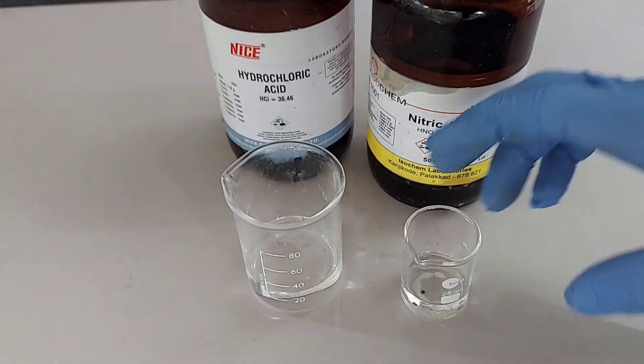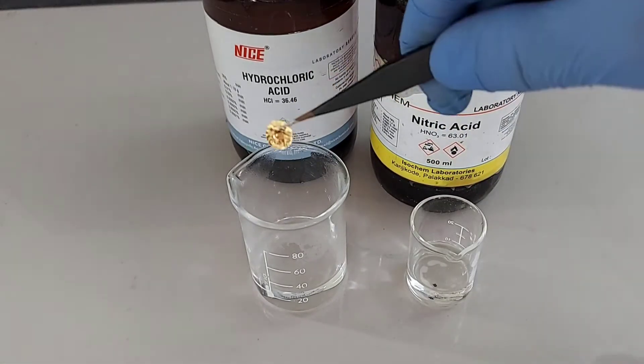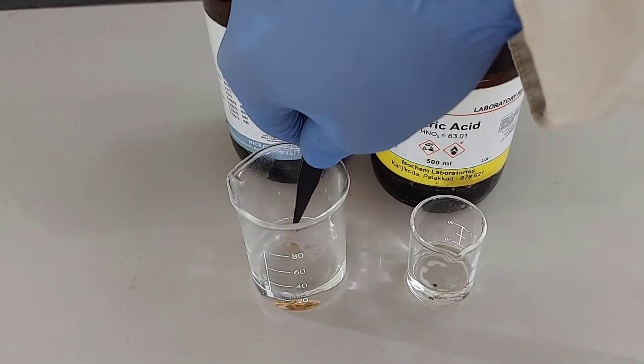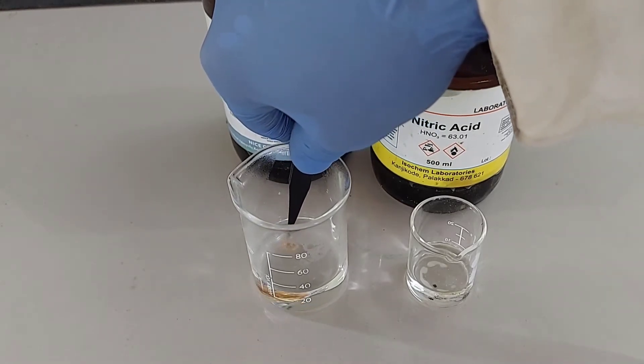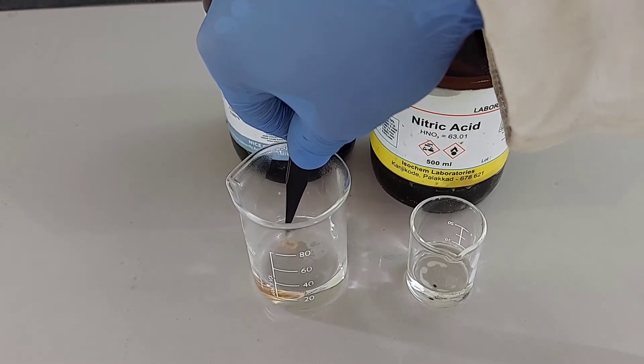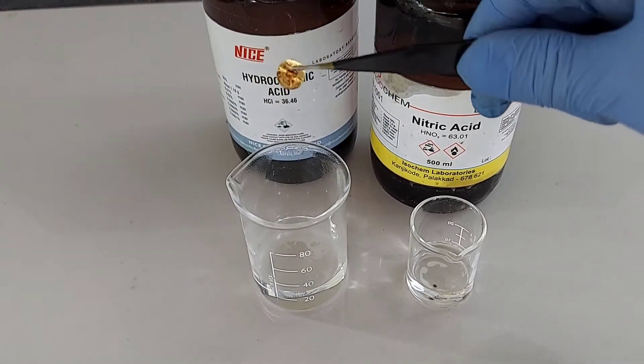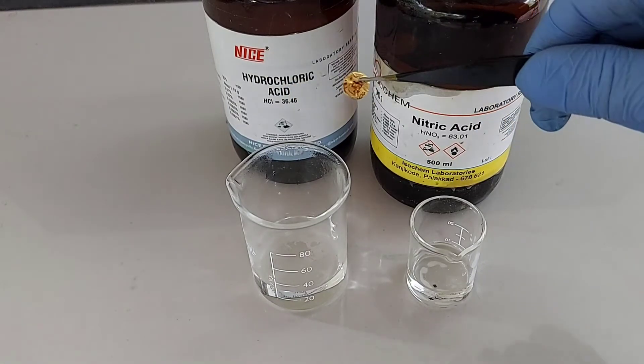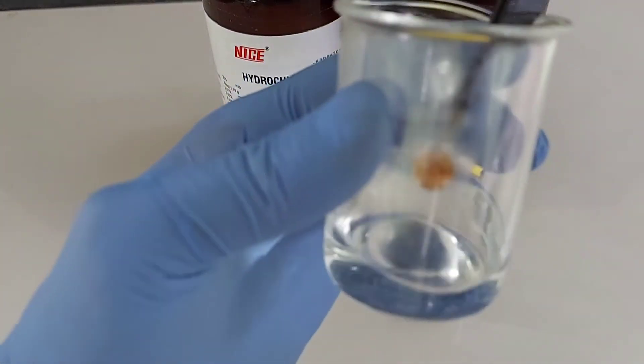You can see here, I am dipping this gold into the hydrochloric acid. You can see nothing happens here. Not even a single amount of gold will dissolve in hydrochloric acid. Concentrated hydrochloric acid cannot dissolve gold. You can see clearly here, I am dipping it completely inside this hydrochloric acid.